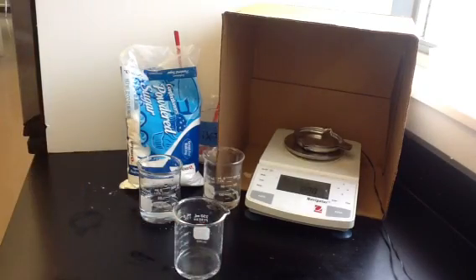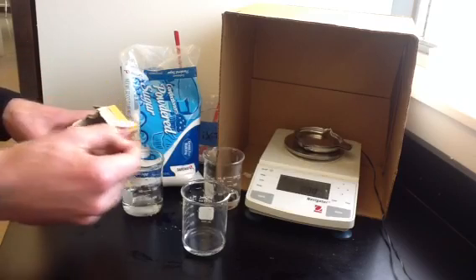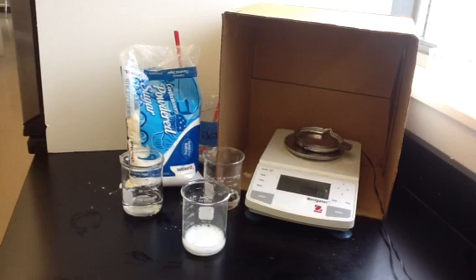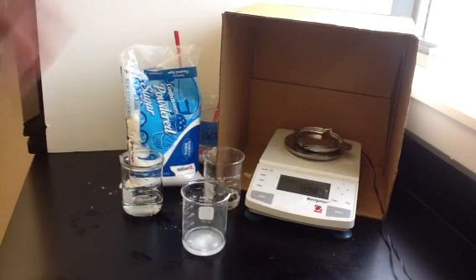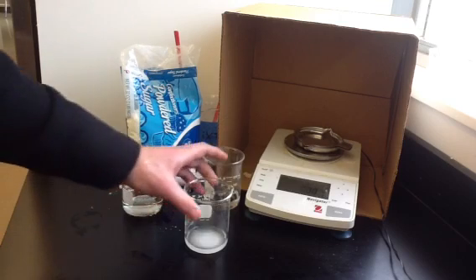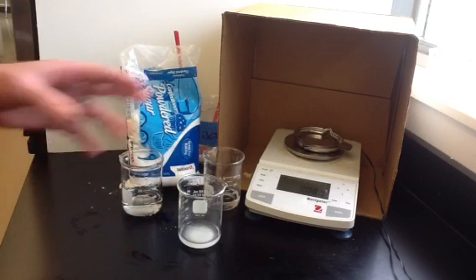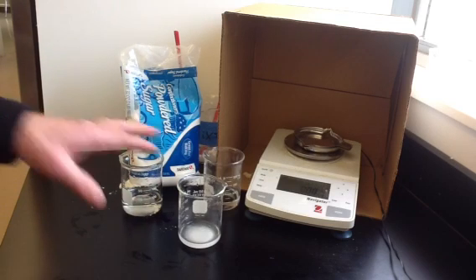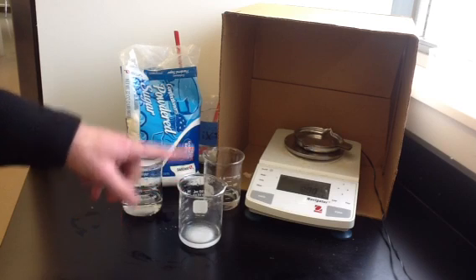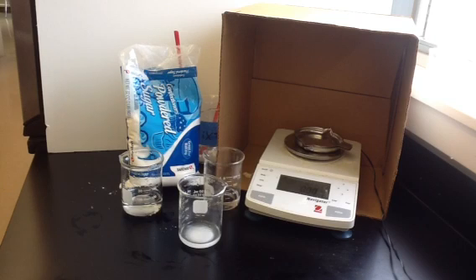First, we'll take a look at a couple of reactions. If we take acetic acid and add sodium bicarbonate to it, you can see that it fizzes — it produces carbon dioxide gas. The carbon dioxide gas is being released as the sodium bicarbonate reacts with the acid. If we weighed this at the beginning and weighed it again at the end, it would actually weigh less, because of the carbon dioxide that was released. So it's easy to figure out how much carbon dioxide was released by measuring the mass before the reaction and after — however much mass was lost, that's carbon dioxide that was released.